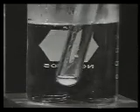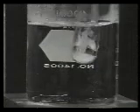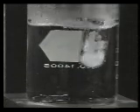The first step in a recrystallization is selecting a suitable solvent. In an ideal solvent, the solid is virtually insoluble at room temperature, but very soluble when the solvent is heated to its boiling point. To find a suitable recrystallization solvent, test the solubility of your compound in different solvents.